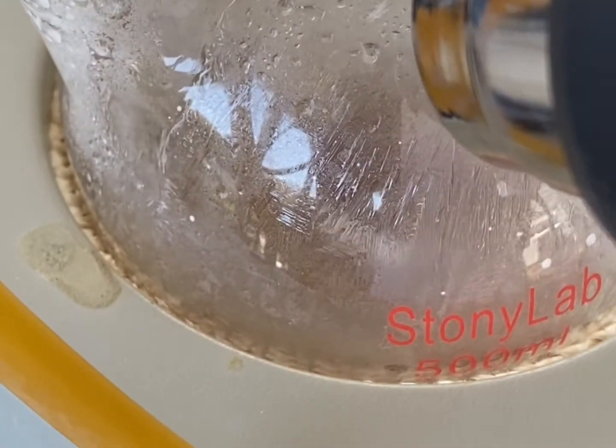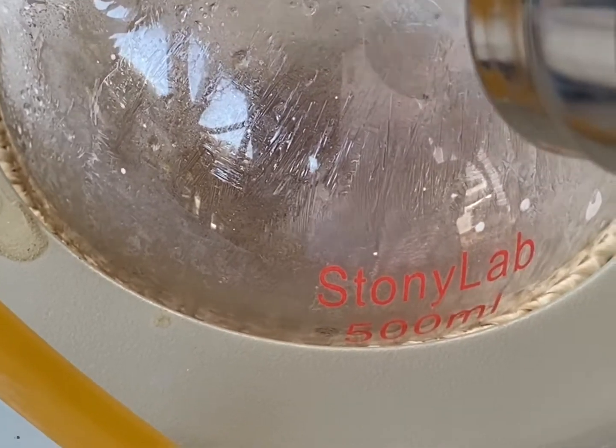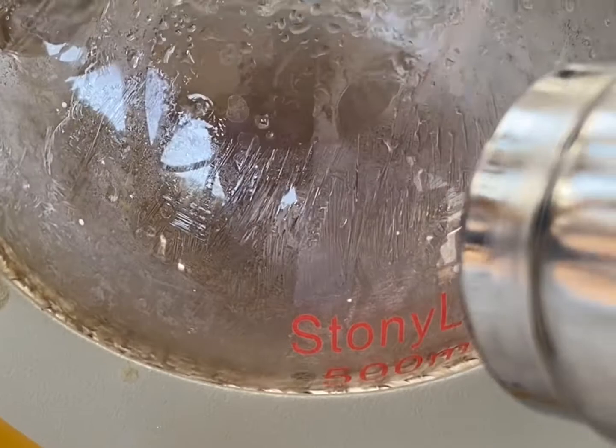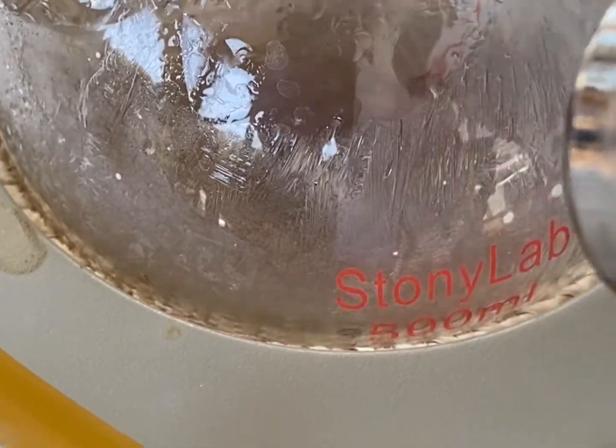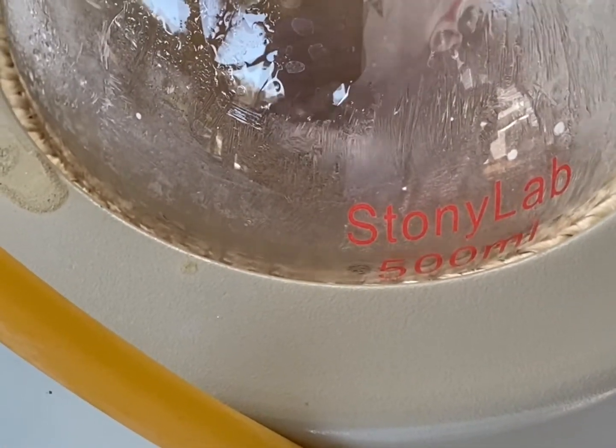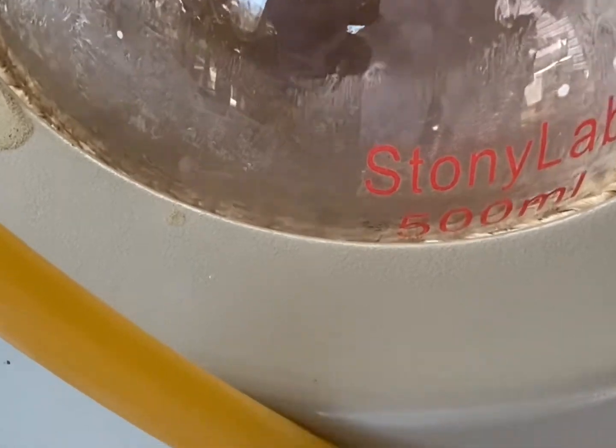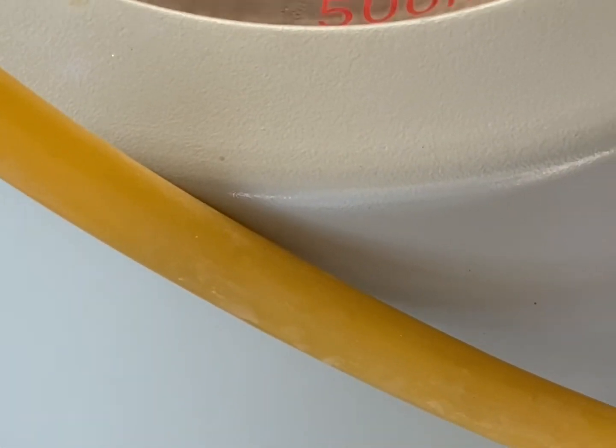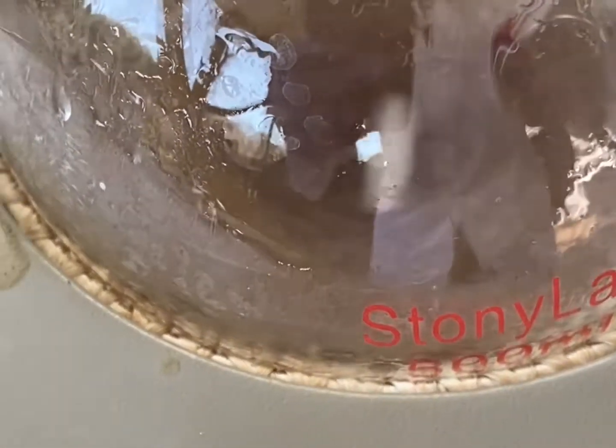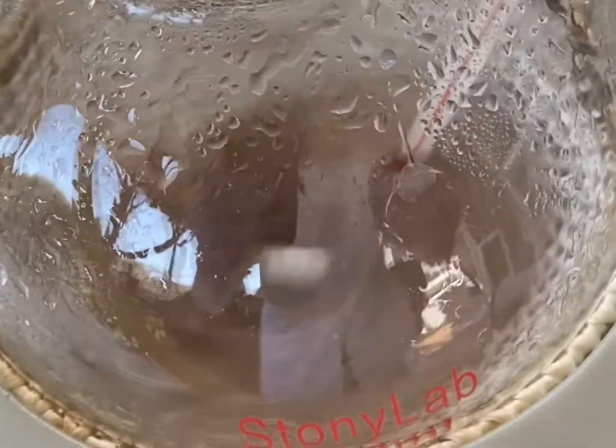In a couple of seconds, you can see that when I use the heat gun, the naphthalene that's condensed on the surface clears away. That's why I think this is useful to have, just in case something like this were to happen. As you can see, the solution is getting darker and darker, and it'll become nice and dark. It's pretty neat.